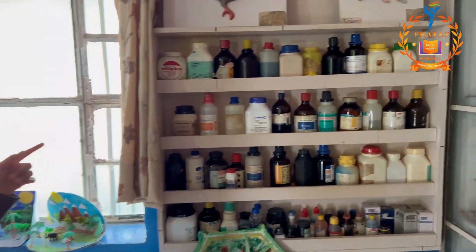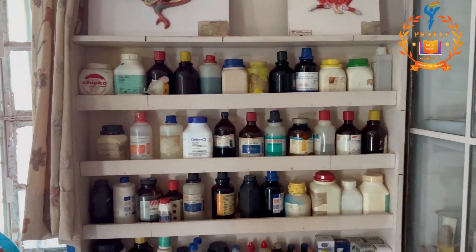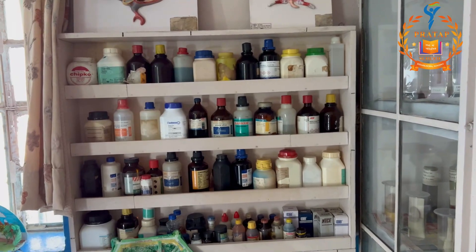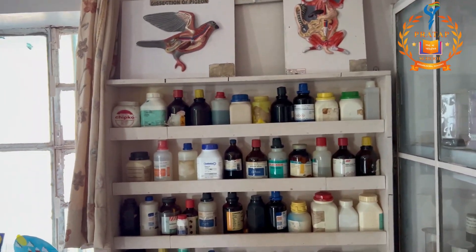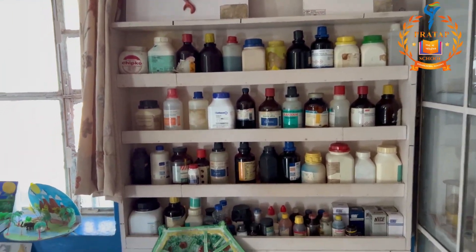And these are the chemicals and stains used for different experiments, like preparation of slides or isolation of DNA.